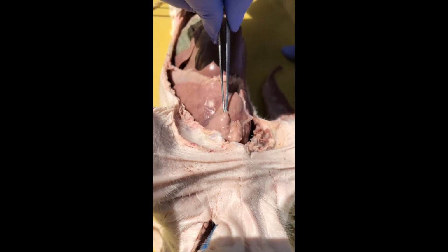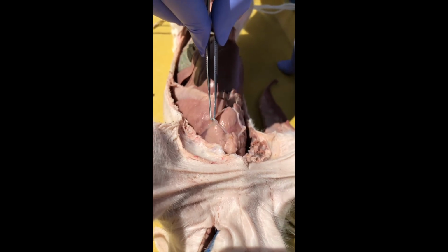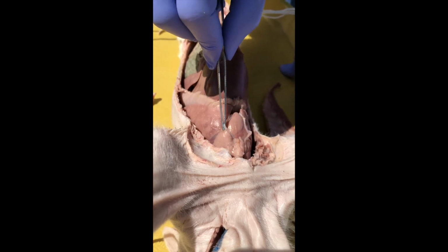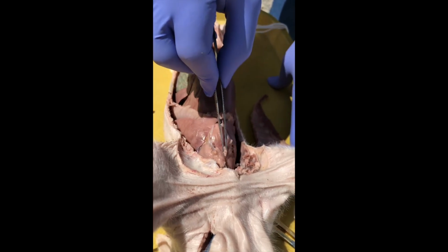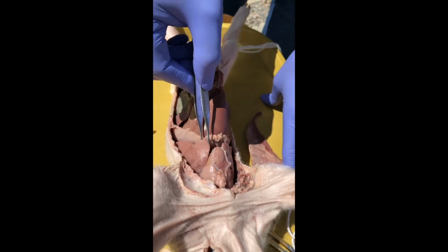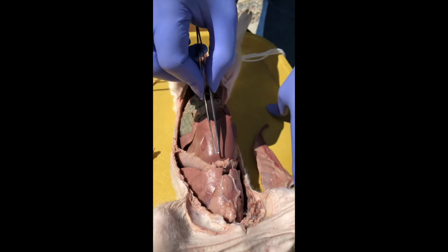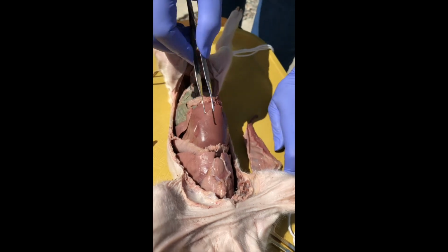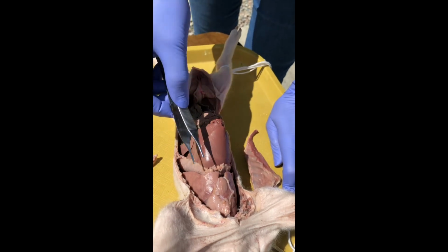And the thymus gland is where our T cells, those are white blood cells that act like the generals of our immune system, are made. So think of the thymus gland as like West Point of the immune system, sort of like West Point and the Naval Academy and the Air Force Academy all in one. Anyway, these are lungs. And by the way, before we leave the chest, we're going to see more thymus in the throat, because the thymus glands of fetuses, infants, and children are huge, of course, because they're training their generals.